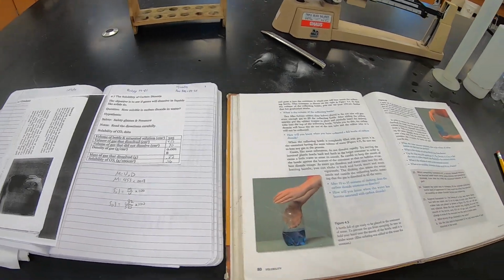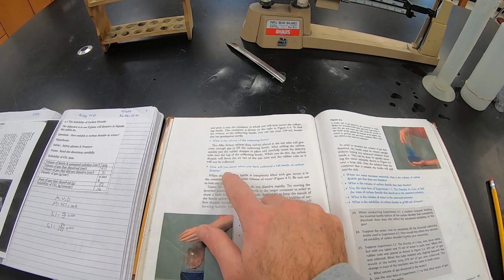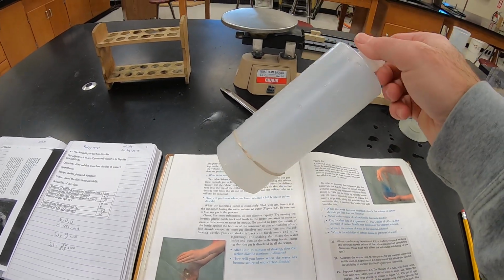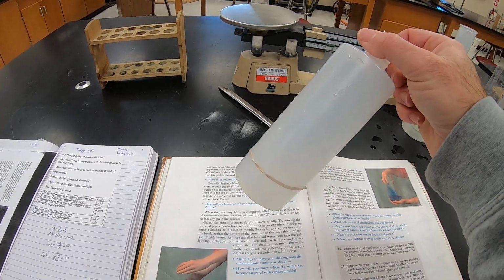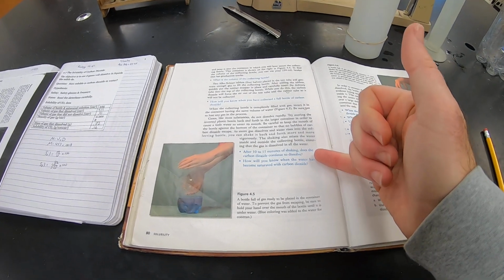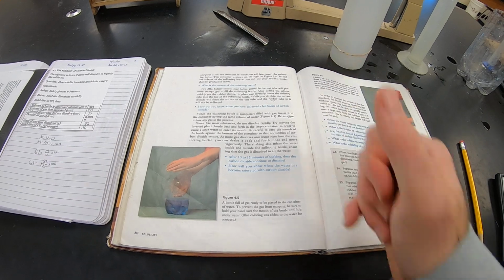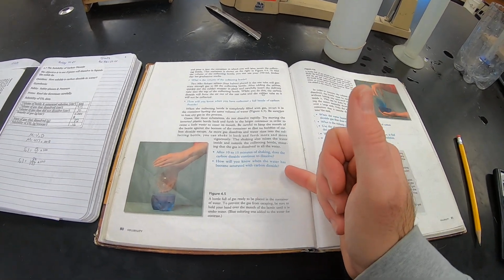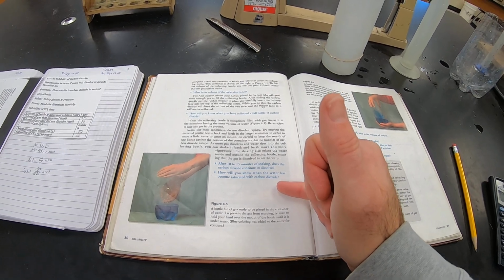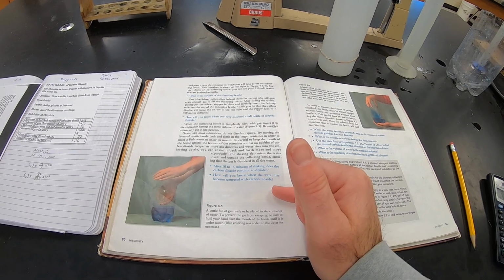And so let's go back up here and talk about the blue questions real quick. How do you know when you've collected a full bottle of carbon dioxide? This is in the setup phase when we first started. Well, this bottle is not going to have any more water in it. Okay, so that's BQ2. BQ3, after 10 to 15 minutes of shaking, does the carbon dioxide continue to dissolve? That's no. How will you know when the water has become saturated with carbon dioxide? Well, the water level stops rising when I'm shaking. It no longer goes up.